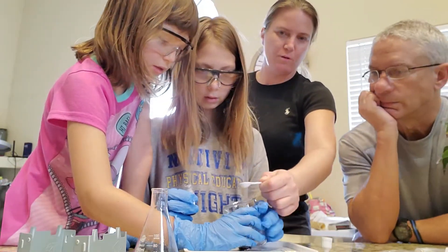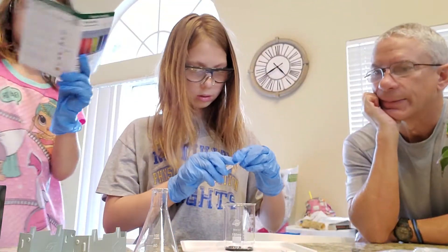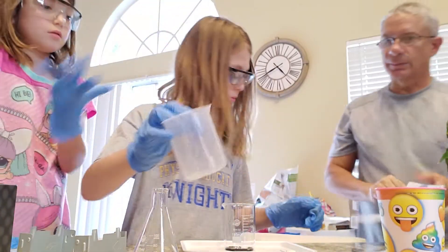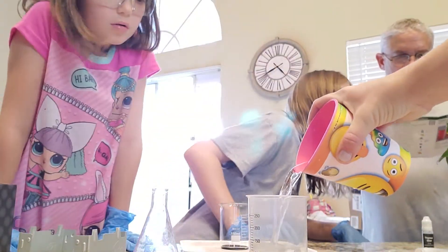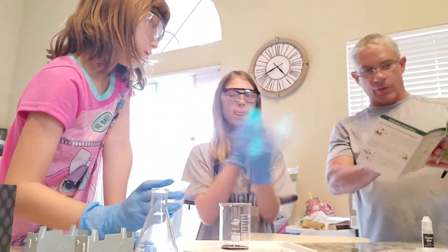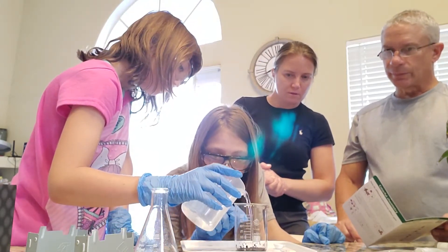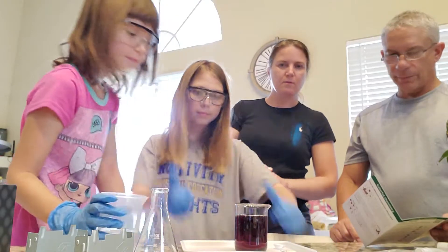What color is it? How many spoons? One. Now what do you need — water? Yeah, but it doesn't say how much. I'm sure it does — just read it. It just says water. We have this. It's supposed to be in this one. How much? It doesn't tell you. You fill it up to there — see? Oh, okay. That's how perfect we have it. And then how much you pour in — we need to pour the whole thing. Up to here. I'll tell you where to stop. Stop. Okay, that's red.